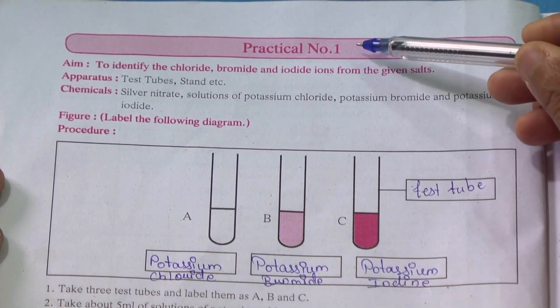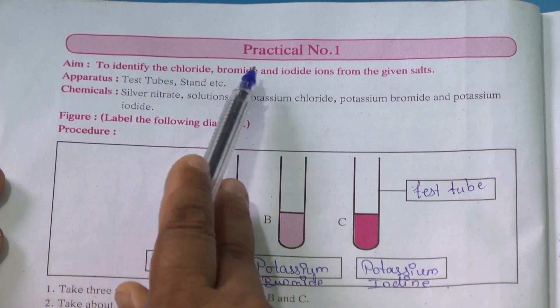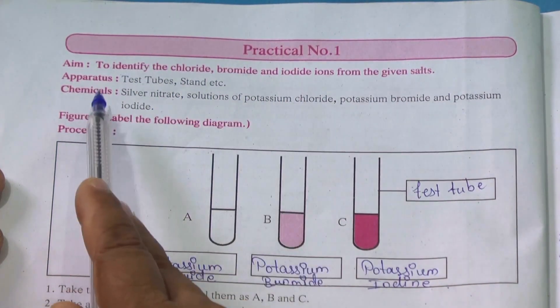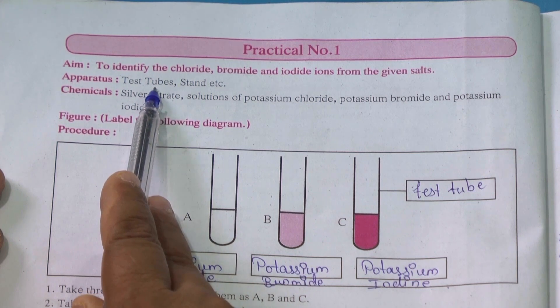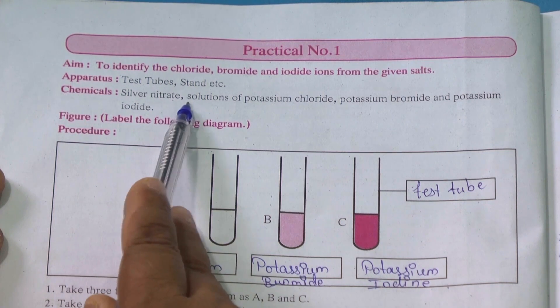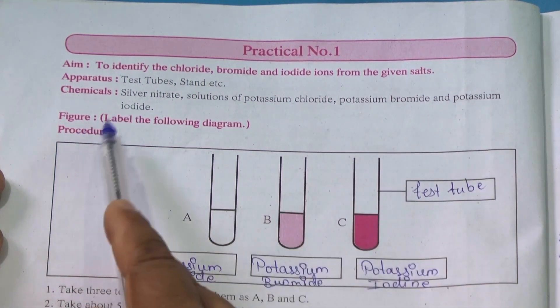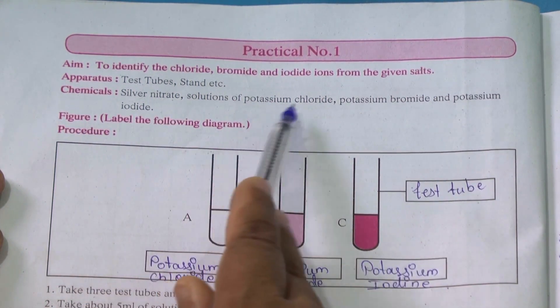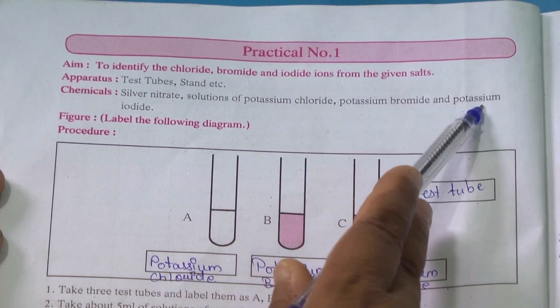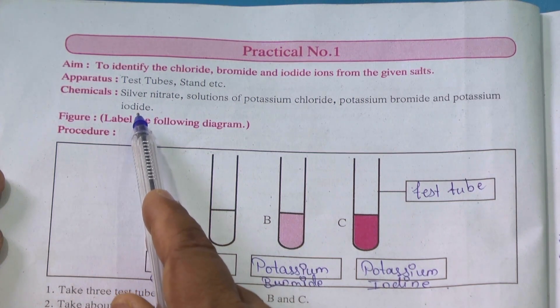Now we will be doing practical number one in which the aim of the experiment is to identify the chloride, bromide and iodide ions from the given salt. The apparatus we will be using is test tubes and a test tube stand. The chemicals we will be using are silver nitrate solution, potassium chloride, potassium bromide, and potassium iodide. Potassium chloride contains chloride ion, potassium bromide contains bromide ion, potassium iodide contains iodide ion, and we need to detect them.